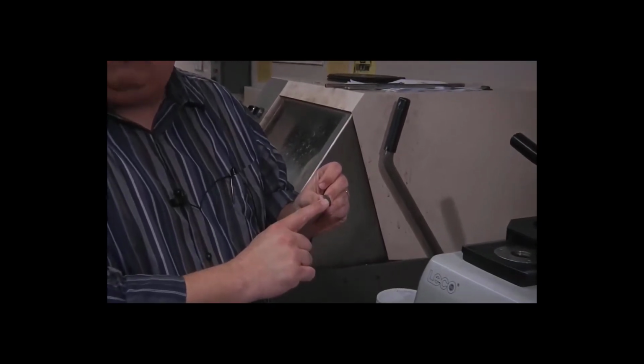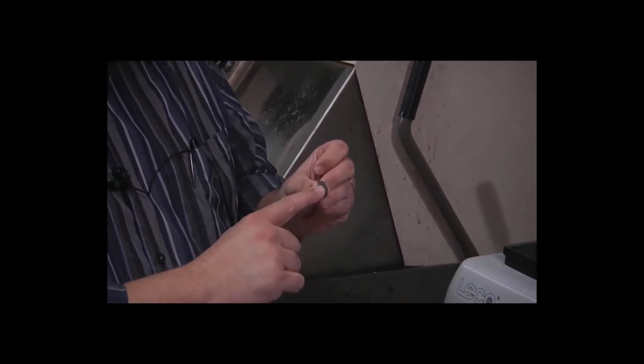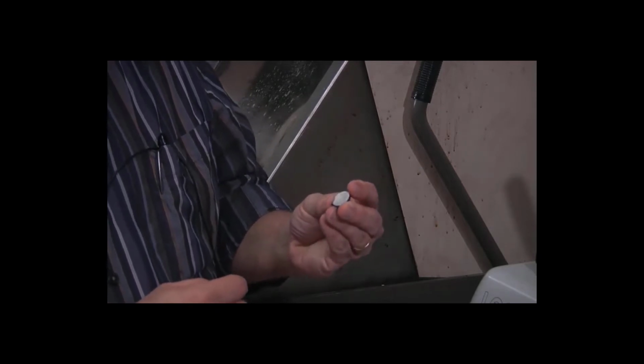Okay, so now that the cutoff group has supplied us with our first specimen from the 1018 steel, we're ready to mount it in the plastic puck. Now you'll notice that there is a fairly good sized burr on this part. That's a natural part of the cutoff process. The only thing that we're really concerned about is that the cut looks relatively even and that there's no burn marks on it, which means that we had excessive heat during the cutting process. The burr doesn't concern us because we can bury the burr inside the plastic puck.